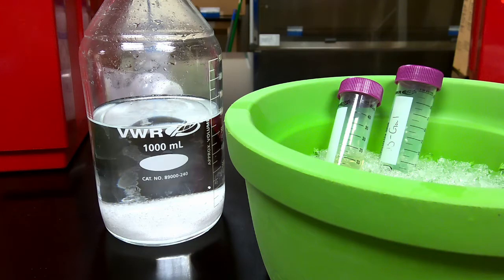All right, so just kind of jumping into the future. The last time, what I showed you was me putting our lysed cells in the hula shaker after adding DNase so that we could chop up all the DNA. The reason we did this was so that we could make the solution less viscous, so that when we spun it down, the DNA wouldn't pull our protein down into the pellet. We want the protein to stay in solution. After I let it shake on the hula shaker, the solution did actually become very liquidy.